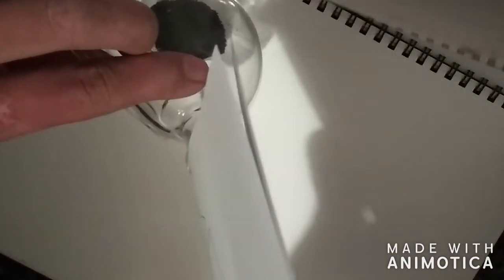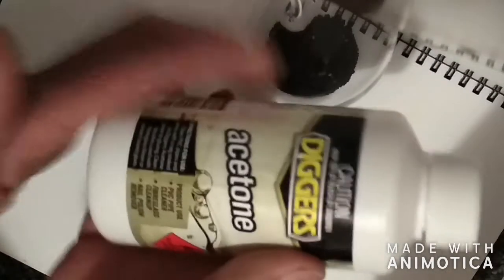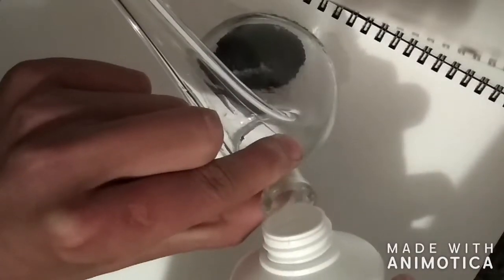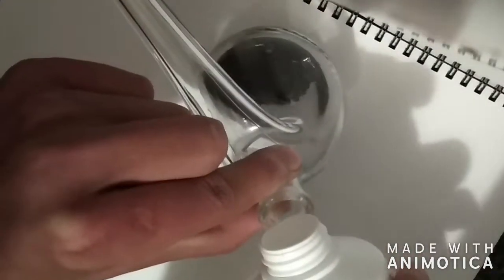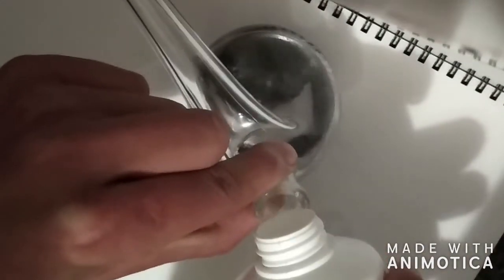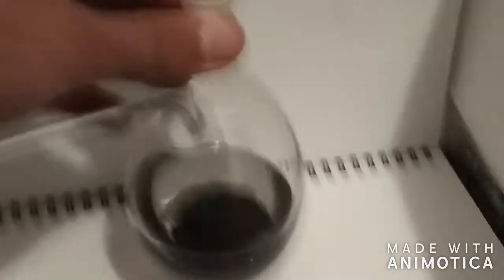But we just need to separate them out now. To obtain pure sulfur, we're going to need to use acetone. I'm only using acetone as it's the only thing I have that could dissolve sulfur, according to one website — though I'm kind of skeptical since it was the only source I found this on. Other mediums could be used.